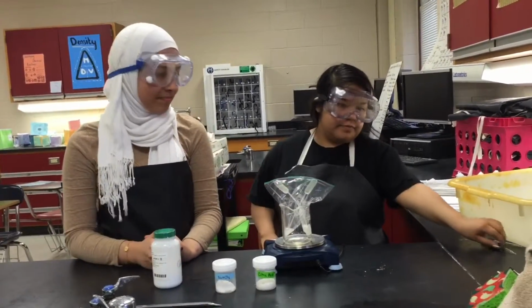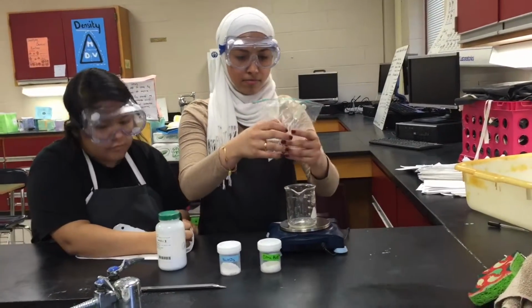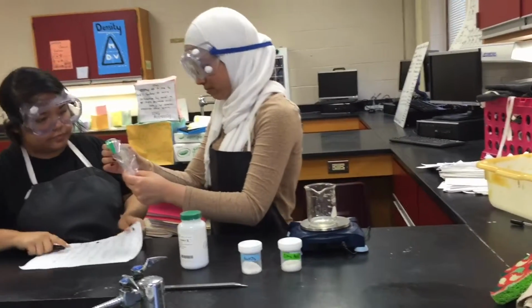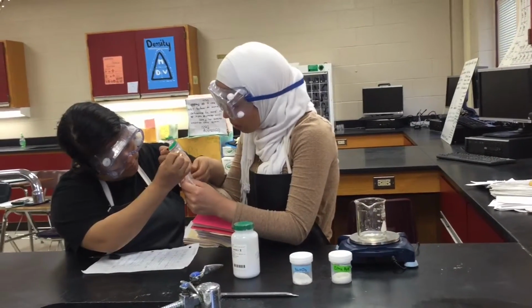Step 6. Remove the baggie from the cup. Lift the baggie from the outside. Squeeze gently the pipettes inside the closed baggie, focusing the stream of water into respective corners to dissolve the solids. Be careful not to suction chemicals into the pipette.